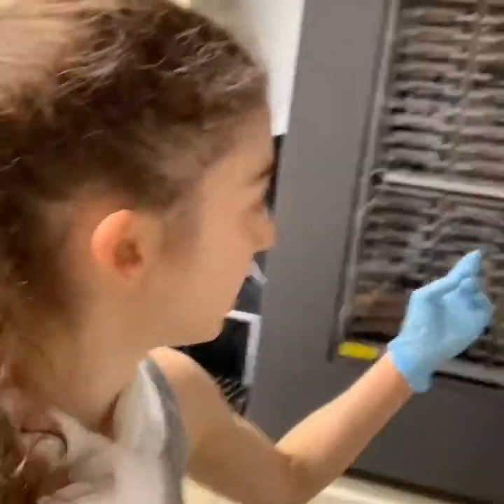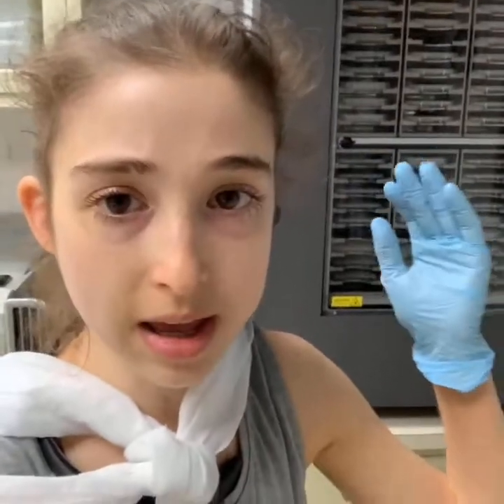Because this video got kind of long, I'm going to save the more practical part for another video. The key thing to keep in mind is that finding the right conditions usually starts off with a lot of screens — you can actually buy pre-made mixes of different combinations of salt, pH, and so on to test. We have a pipetting machine called Mosquito that sets up those trays for us. Once we find an initial hit, we can go to larger drops in bigger plates and then monitor them for crystal growth. This is our Formulatrix machine — we also call it our plate hotel because it holds all our crystallization plates, and it has a microscope that takes pictures of them at scheduled time points.